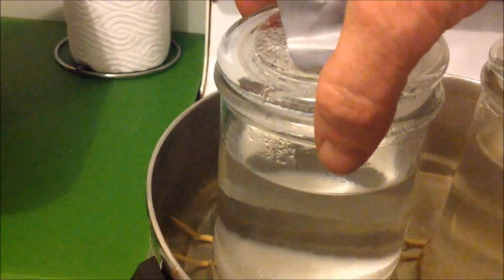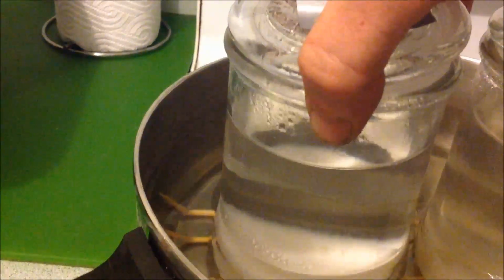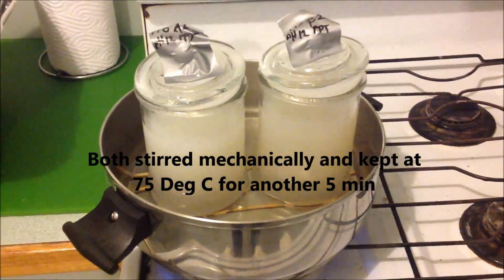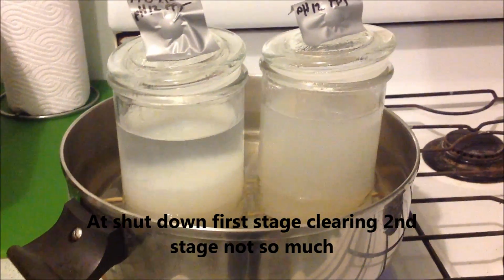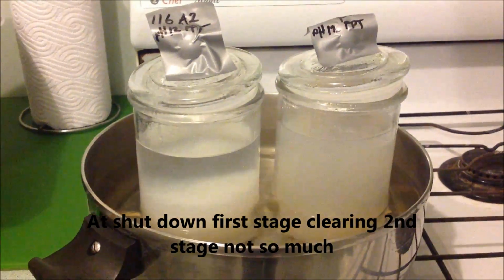I'll just keep it at 75. I'll just stir them both up, and now I'll let them boil or simmer for another 5 minutes at 75. I'm about to turn off. Then you can see A is settling quickly, whereas B is not so.